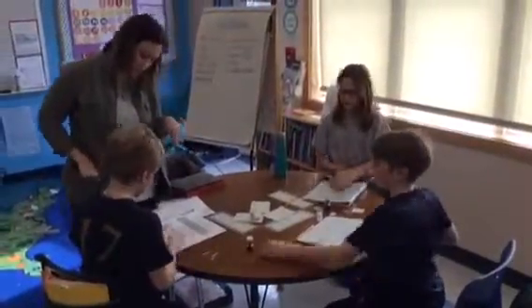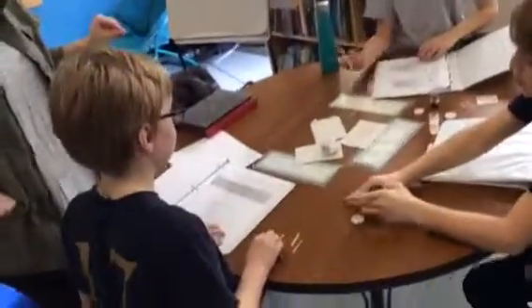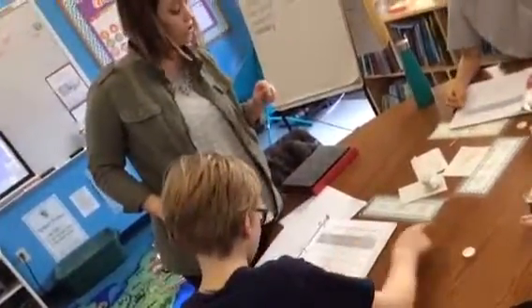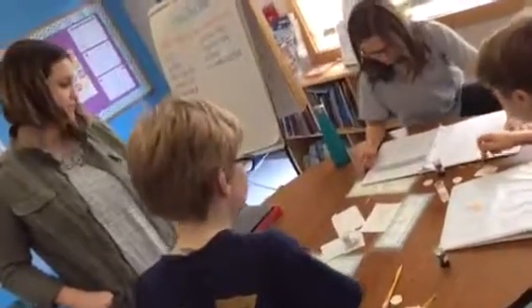So did the car factory sample change over time? 6. That is not what I expected. Did the car factory sample change over time? No. It didn't? Yes, it did. What did the car factory used to be? It used to be a 7.